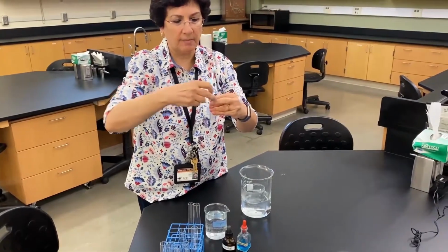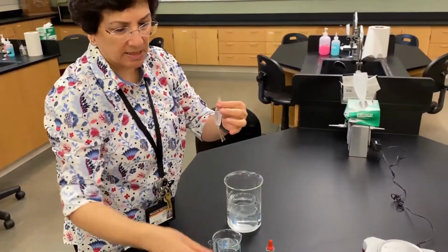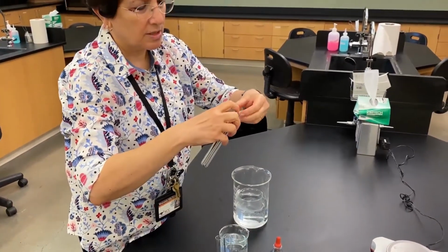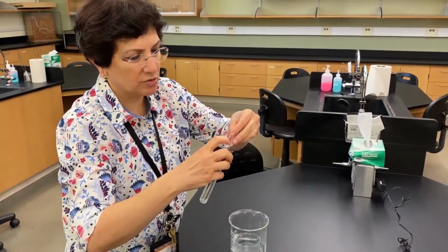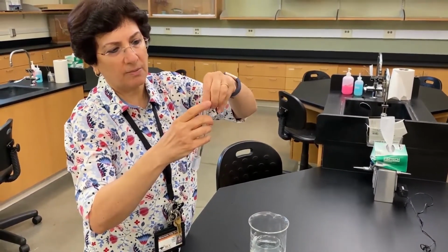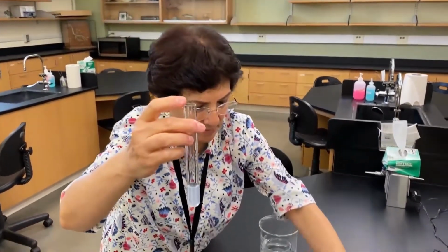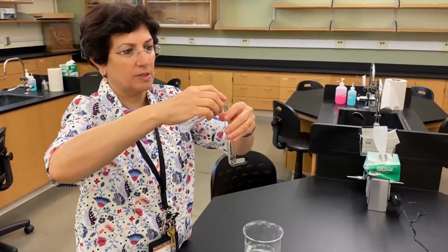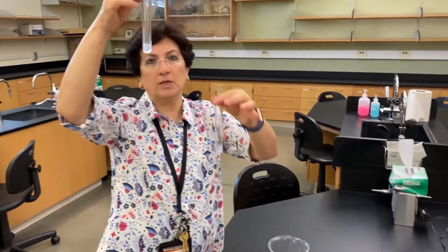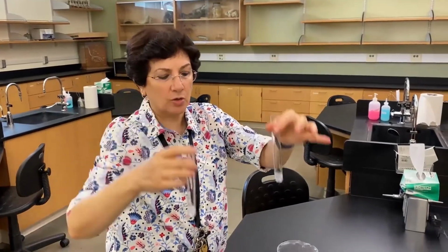This is what in your lab manual would say inside. So we're gonna again test for the presence of starch and glucose. Yes, we know there is starch and glucose, but we're still gonna do it to make sure. So the way I do it, just to avoid problems, I always dump everything into 1 test tube, and then I'm gonna split this amount with another tube. And again, we're gonna use 1 to test for starch and 1 to test for glucose.